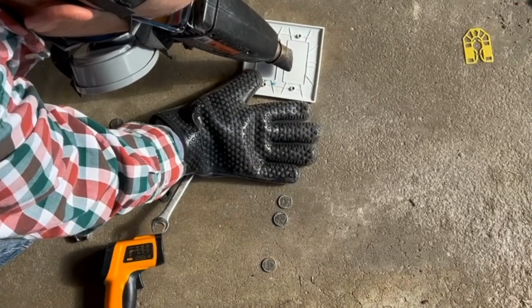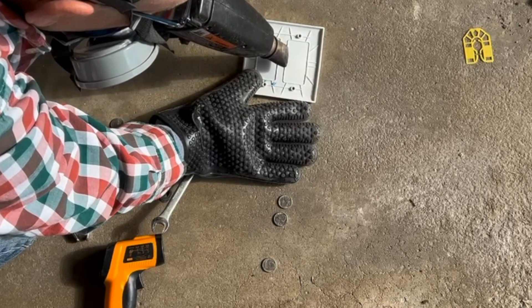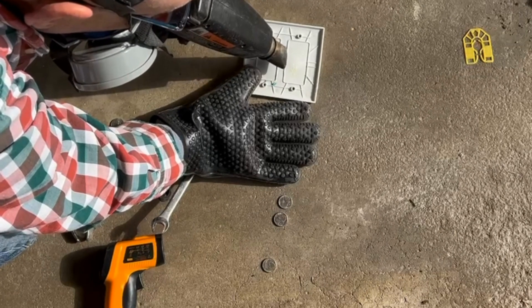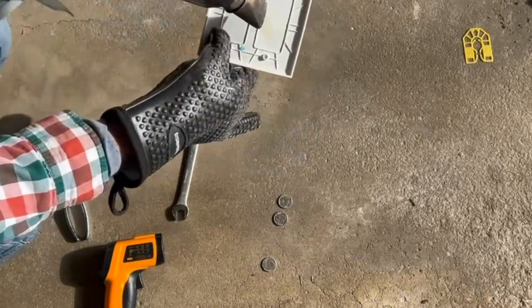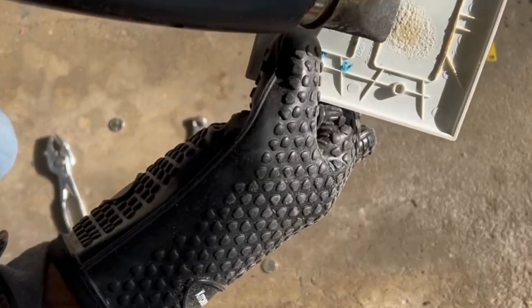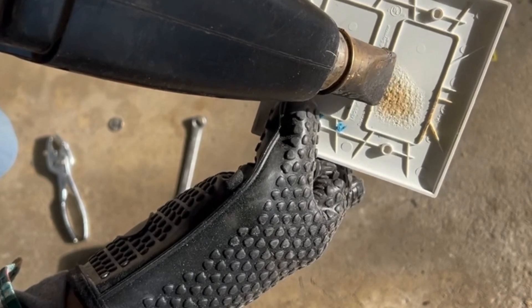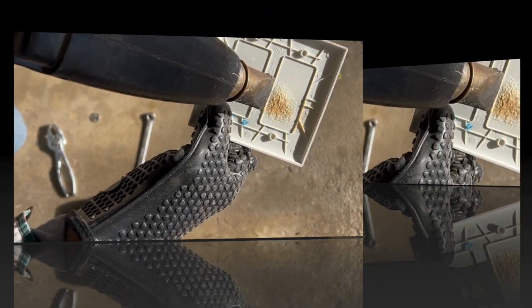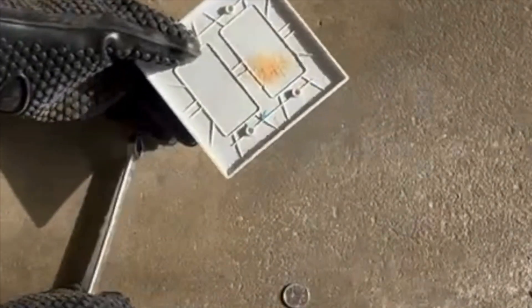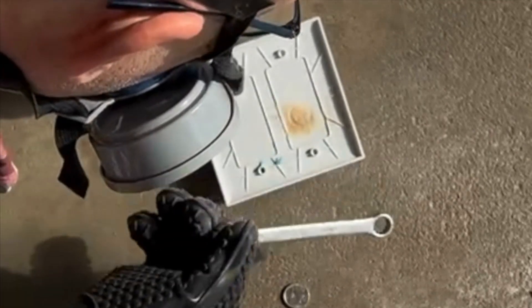Something different happened to this object as I heated it. I noticed a browning on the surface, similar to what you see when you bake something in the oven. I think this color change is evidence of a chemical reaction rather than a phase change, which tells me this plastic is probably a thermoset rather than a thermoplastic. The underlying material has softened some so I can reform it, but I'm not convinced that it's only gone through a phase change.